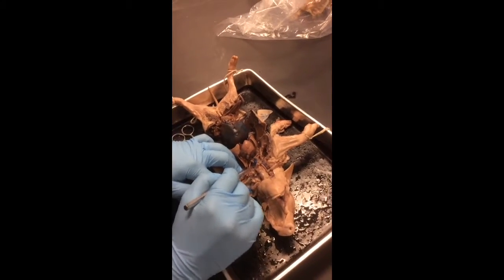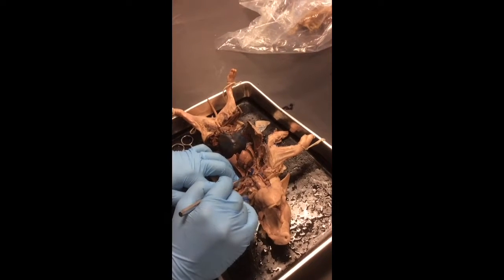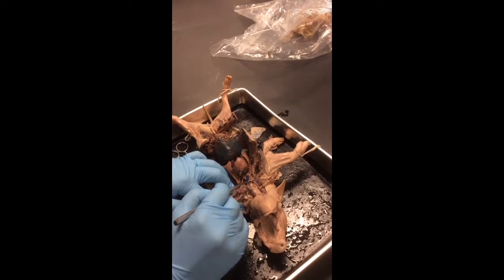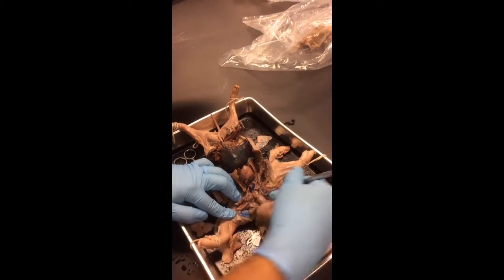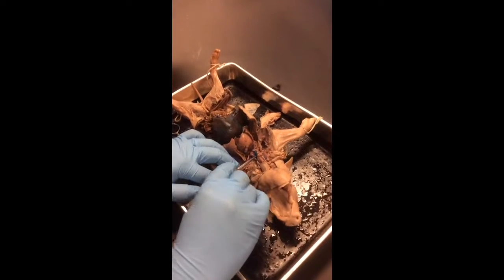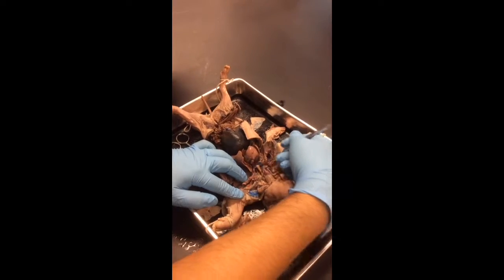Behind the thyroid is the trachea, and the trachea is distinguishable, right? It has those cartilaginous rings, right? So you'll see a lot of lines going around the trachea. Behind the trachea is the esophagus. I don't know if mine has it. It's right here. Okay. Hold it out. It's the esophagus. Okay, so there's the esophagus.